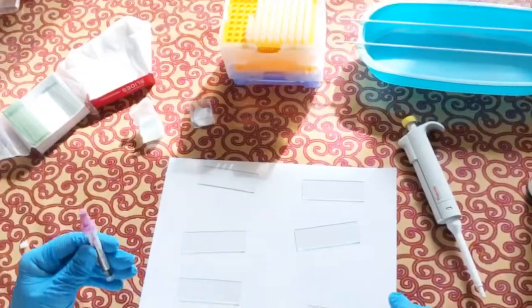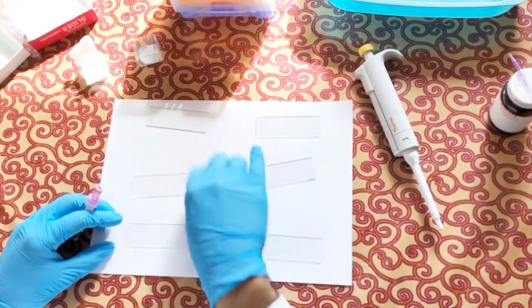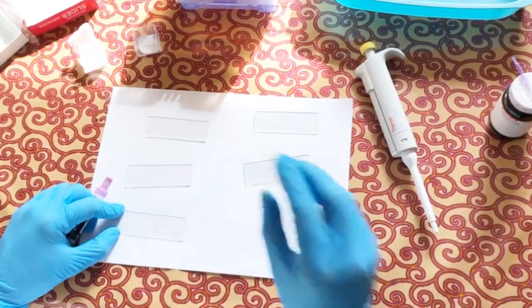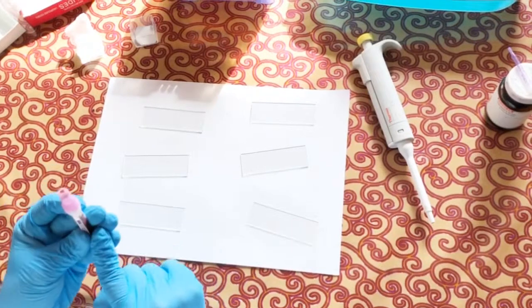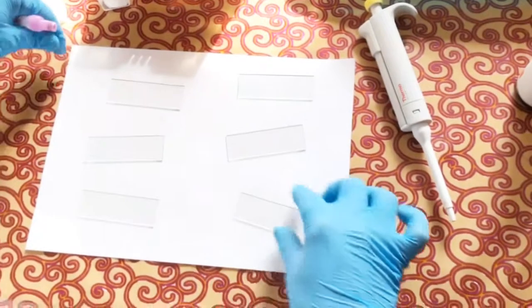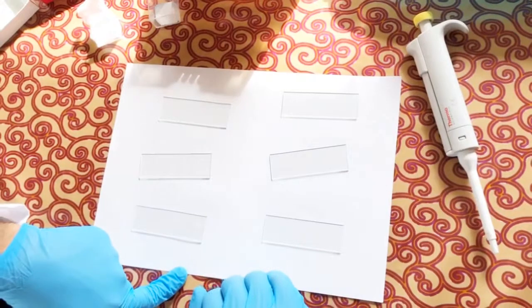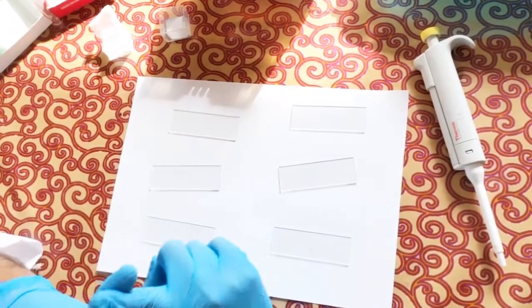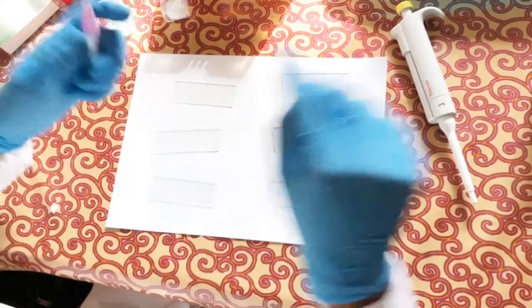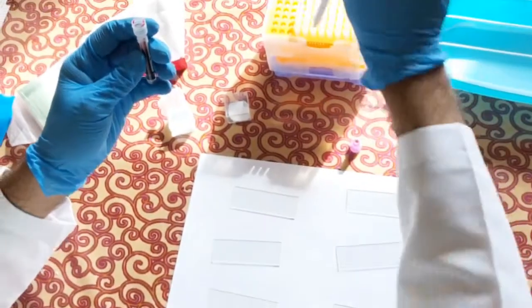In the practical, I have taken around six slides. Five will be used for preparing smears and the sixth will be used as a spreader. I will also use a cover slip, though I prefer a slide for better shape control. As explained in the lecture, the smear must have a head, body, and tail — three distinct sections. Take a minimum drop of blood, not too much and not too little.